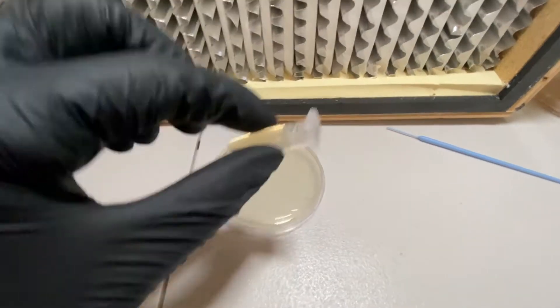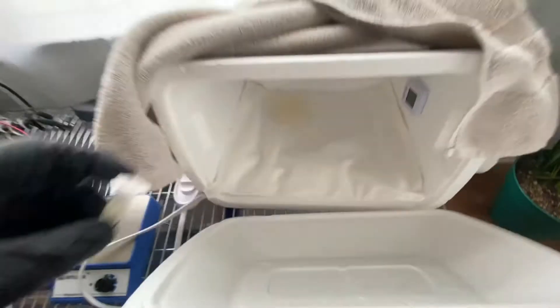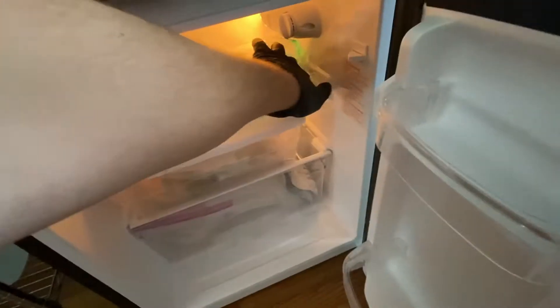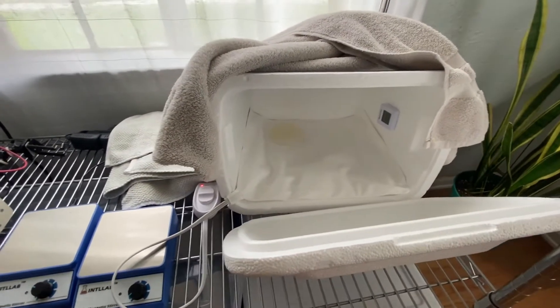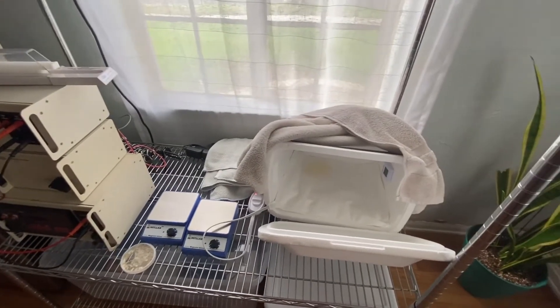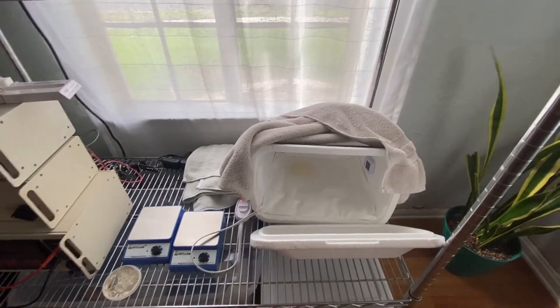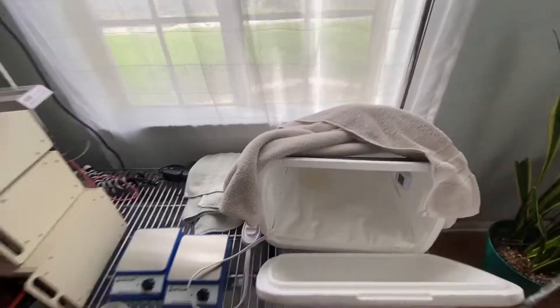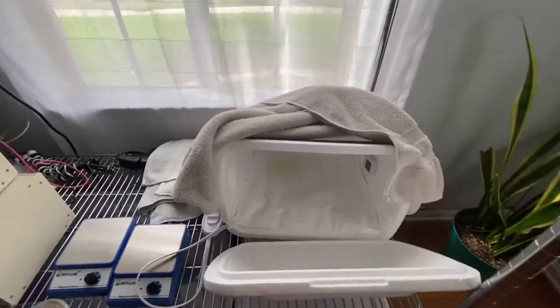Now I can take this and put it back into the fridge, and put the plate into the incubator. We'll let that plate incubate probably overnight until we see anything. And then tomorrow — maybe even tonight if I check back — we'll actually be able to create a liquid culture. Our goal, remember, is to create a lawn on a plate that we can use for our electroporation experiments.